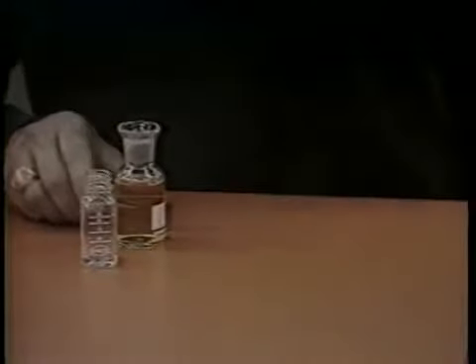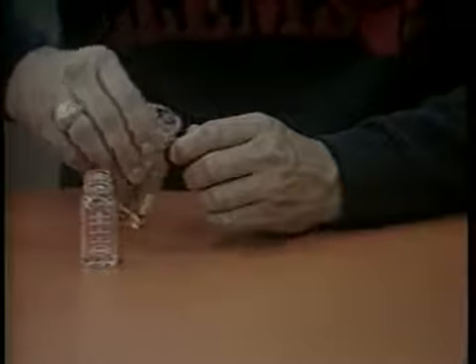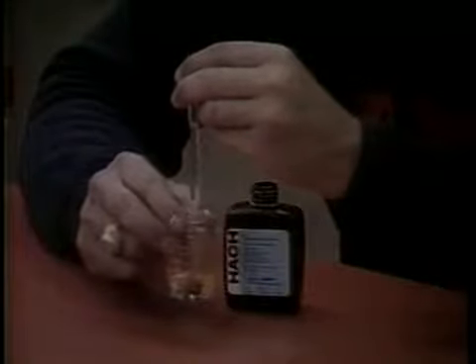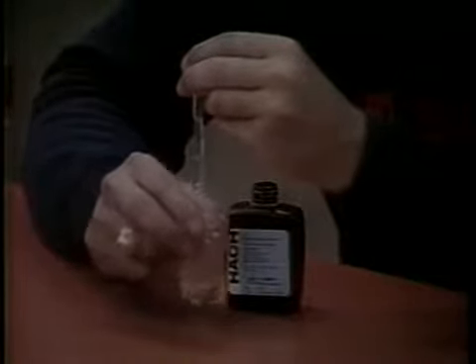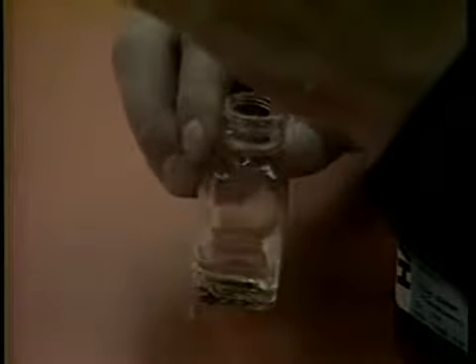Rinse the plastic measuring tube with the sample, then fill and pour the contents into the mixing bottle. Add PAO standard solution drop by drop to the contents of the mixing bottle. Swirl the mixture after adding each drop, while dispensing the drops with the dropper directly above and vertical to the mixing bottle. Add until the color changes from yellow to colorless. Be sure to count the number of drops while adding them.